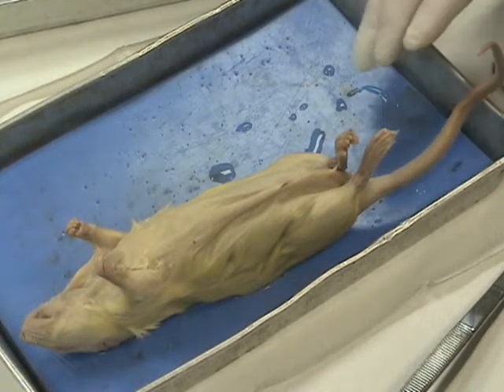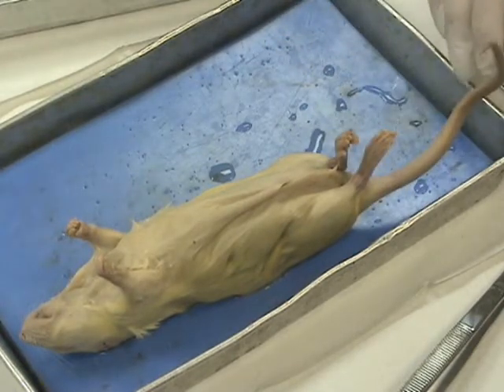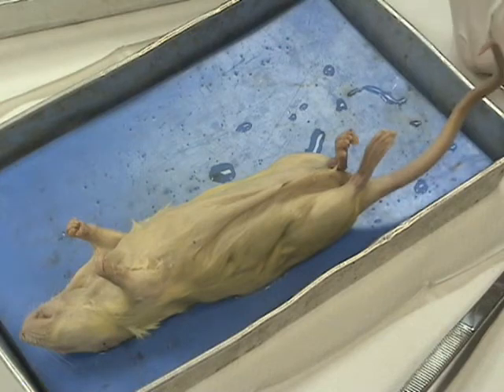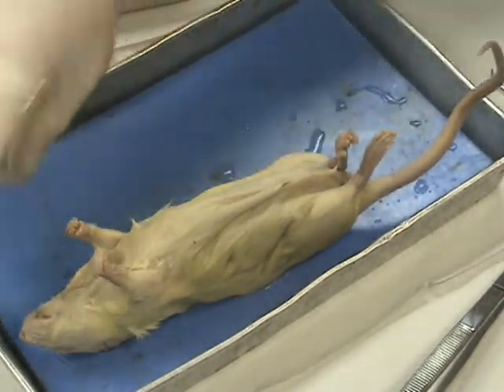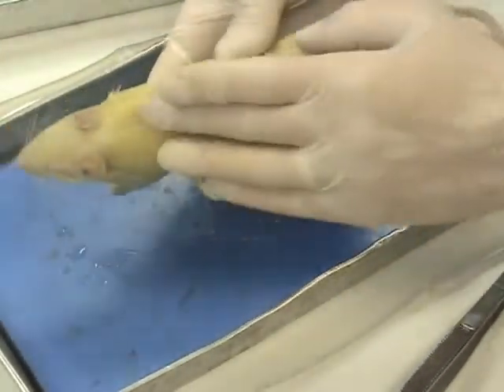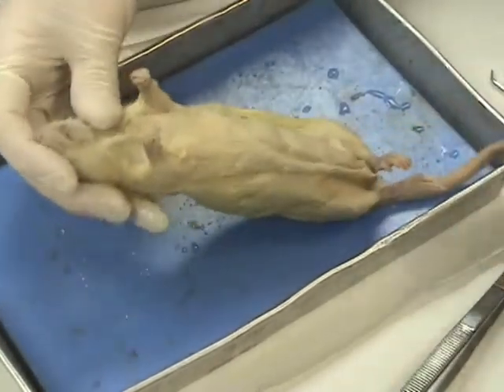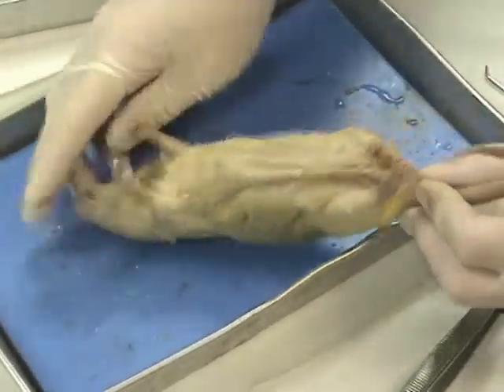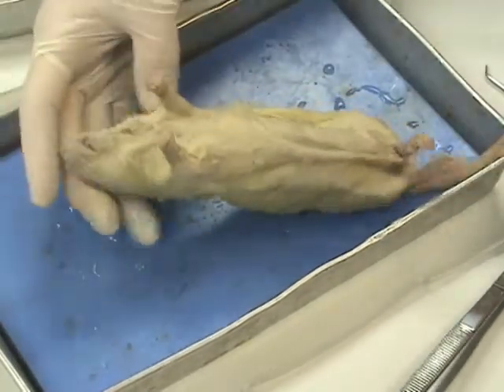And part of it is taking a look at directions. There is no top or bottom, left or right when it comes to the rat or when we do the dissections. What we want to be able to do is start to define terms of where things are, looking at the head versus the tail, the chest side versus the back side. The scientific terms for those would be that the head is called the cranial side, the tail is called the caudal side. In addition, there's another set of terms that describes those too.